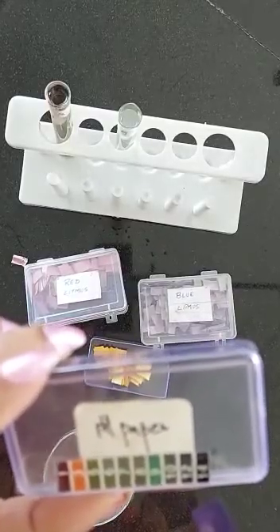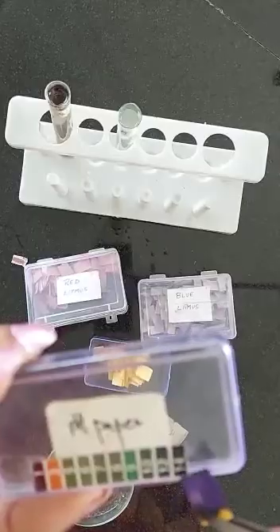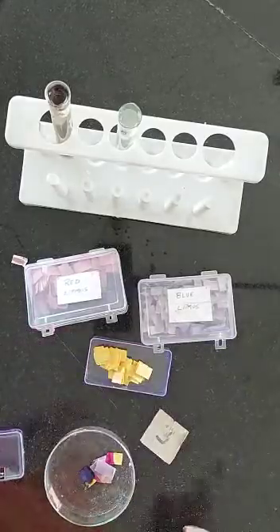The pH number is 14 because it coincides with number 14 on the scale. So how do I write it in my journal? Solution B: red litmus turns blue, blue litmus remains blue, action on pH paper — it turns dark blue, pH number is 14. Hence my inference or conclusion is that this solution is basic, or it is a base, because red litmus turned blue and pH paper is dark blue.